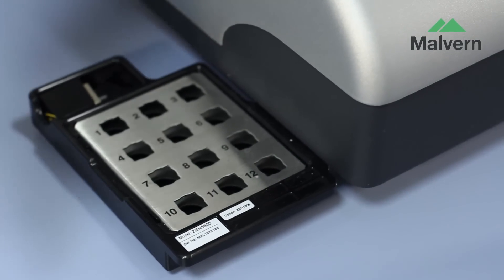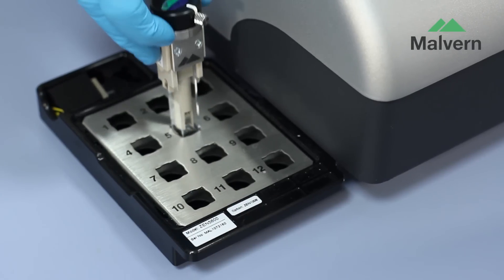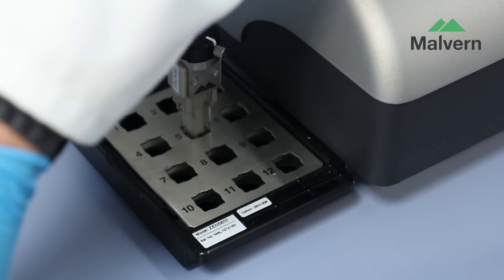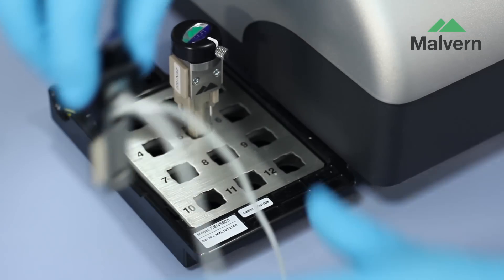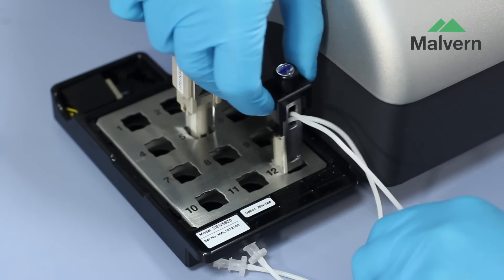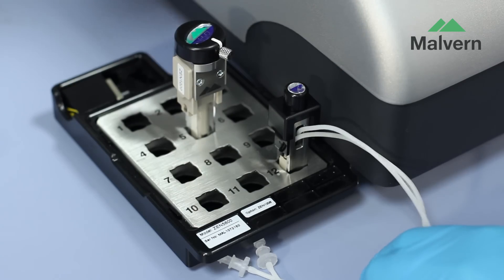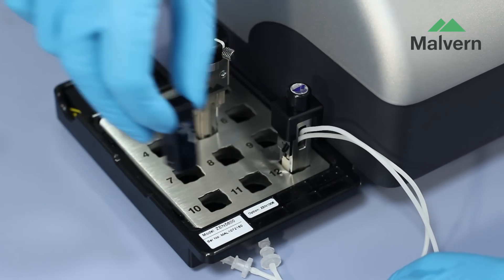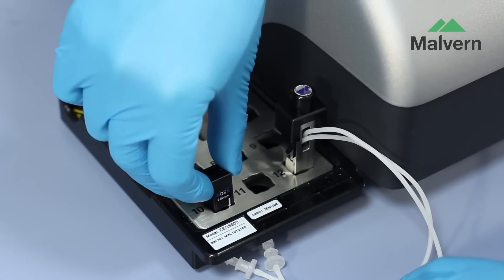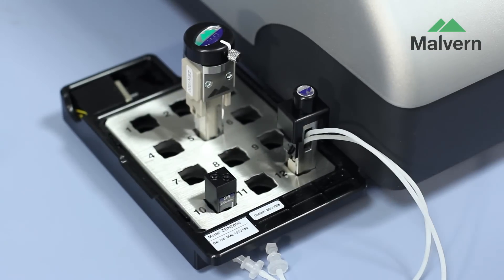Other accessories cater for different sample types, such as the surface zeta potential cell for the characterization of non-conductive surfaces, the high concentration cell for the measurement of highly concentrated samples without dilution, and a quartz flow cell to provide compatibility with a size exclusion chromatography system.